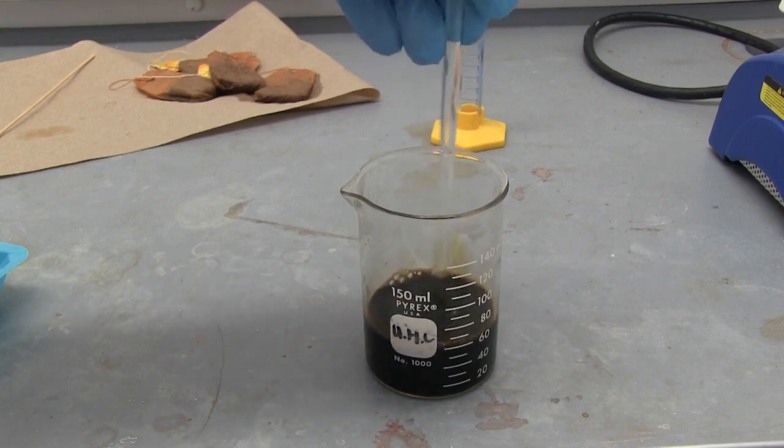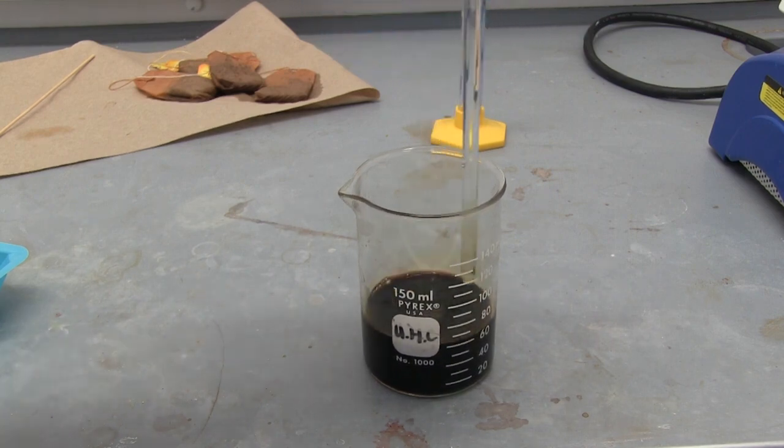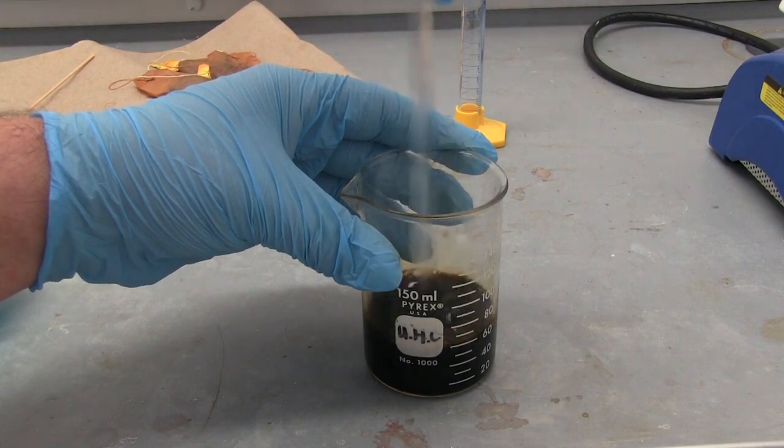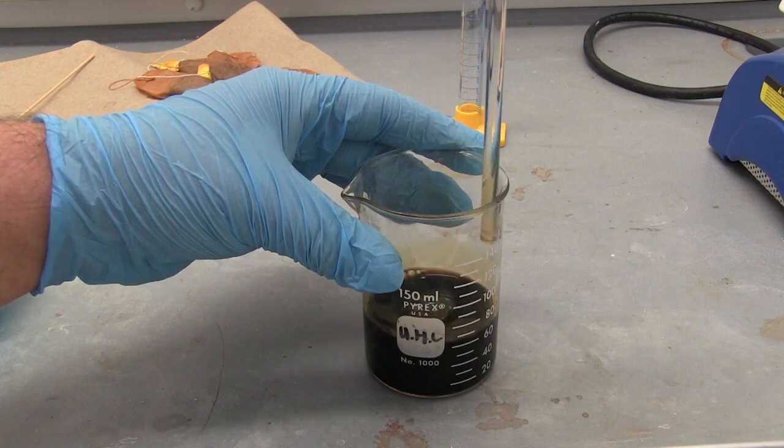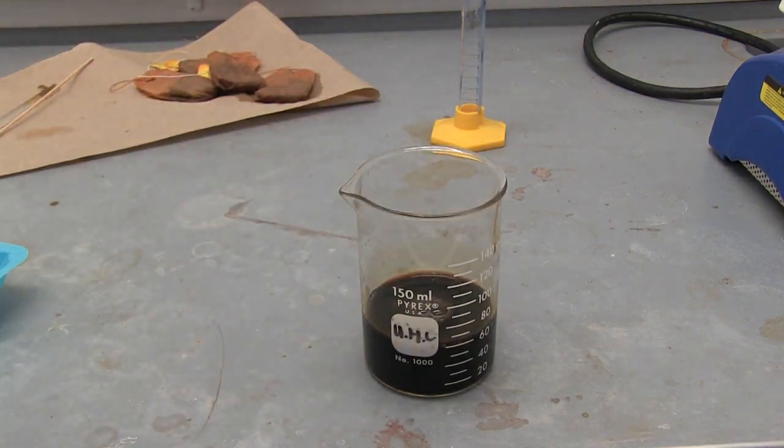Once it looks like it's dissolved, I'm going to add this to a separatory funnel. Mix it up. Alright, now we'll add this to a separatory funnel.